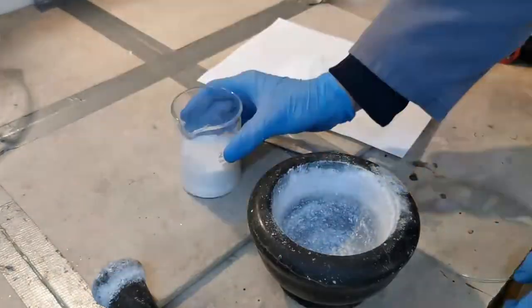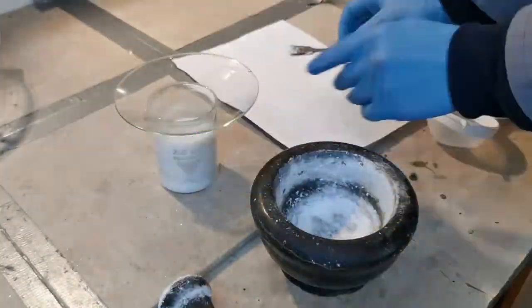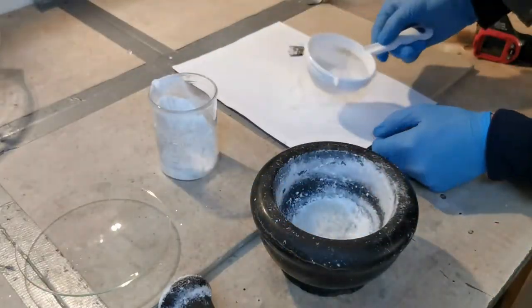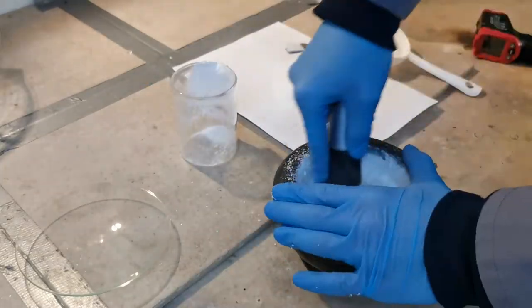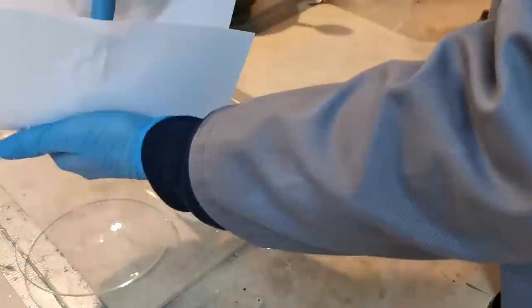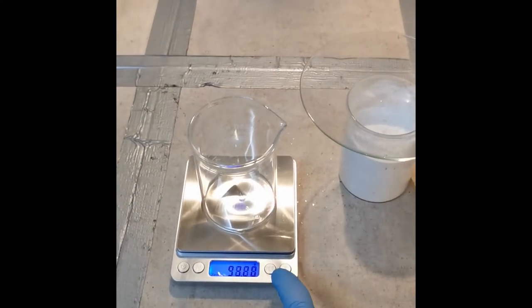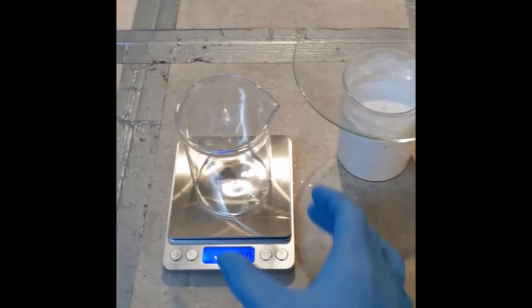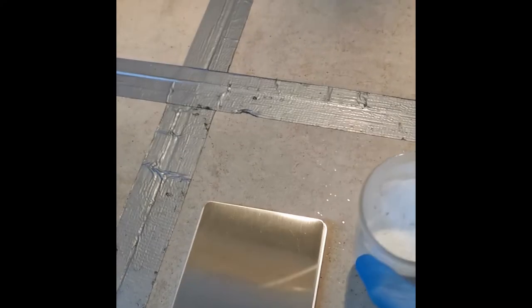I tried sifting it down to crush the larger pieces again but I don't recommend doing that. As this powder is really hygroscopic and will quickly become sticky if left out for too long. And that's basically it. The final product weighs about 200 grams and assuming a yield in the 90% range it fits well with the molar mass of anhydrous zinc acetate which is 183.5 grams.